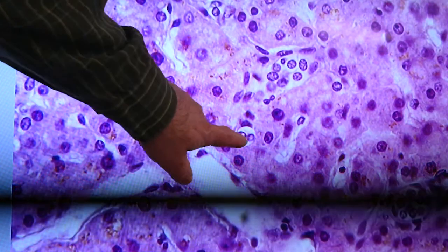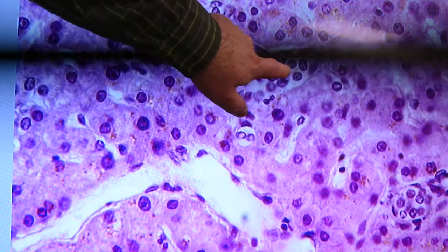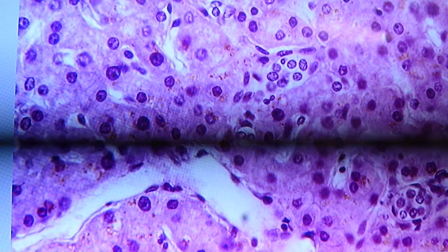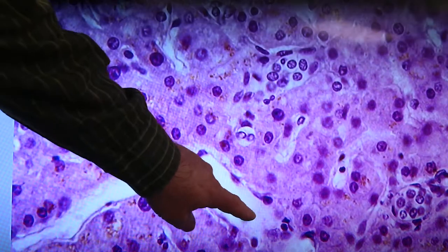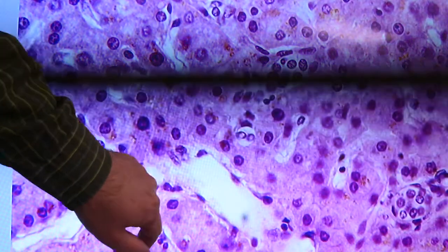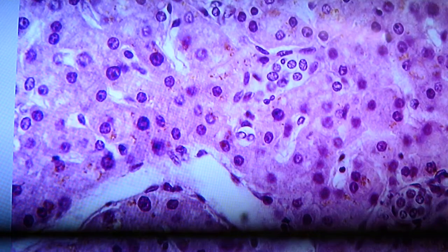Here's one of the tiniest ones I've seen. It just has a couple of nuclei there. But anyway, there's another example right up here. Down over in this corner, there's a nice circle of cells down there. It shows up on the screen. I think we used this somewhere else in the same example here. It shows the nice endothelial cells, the space of Disse and the sinusoid.